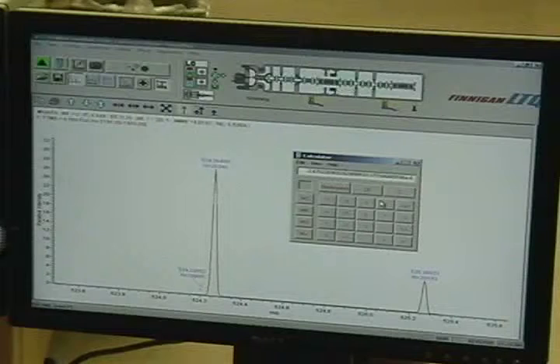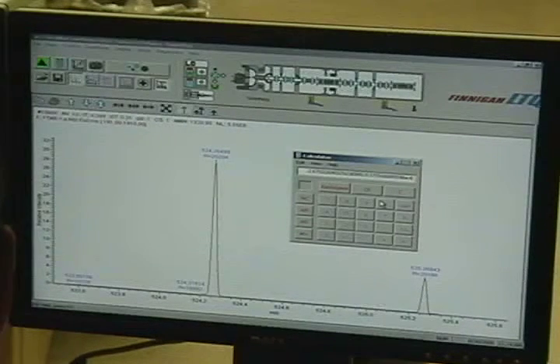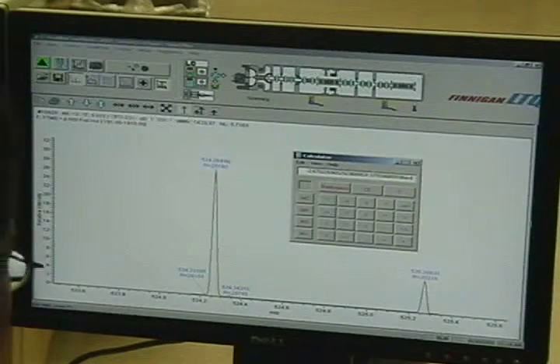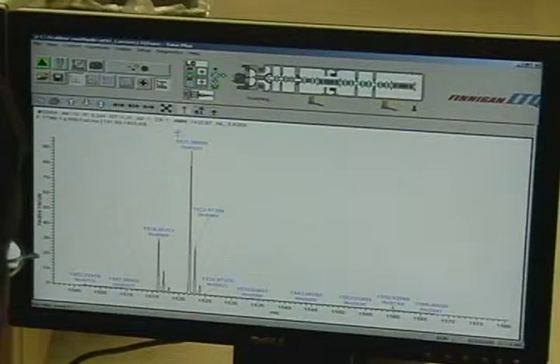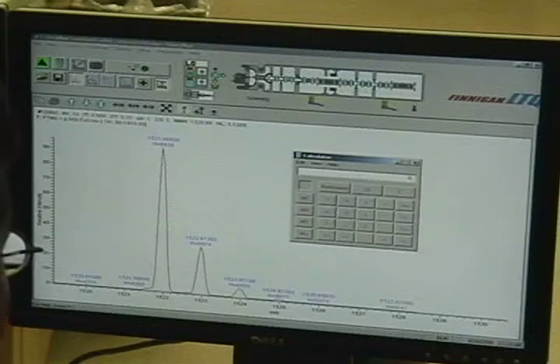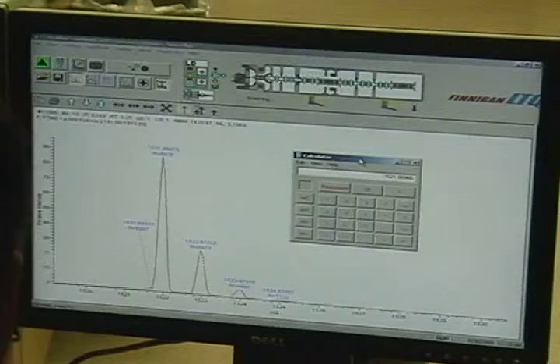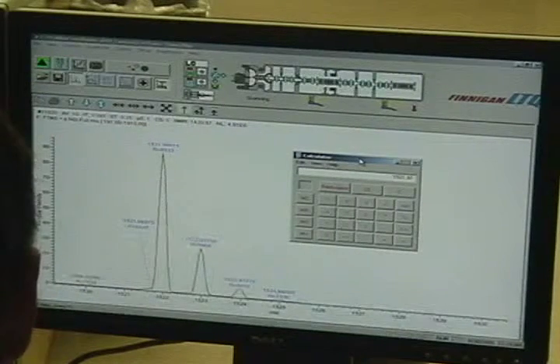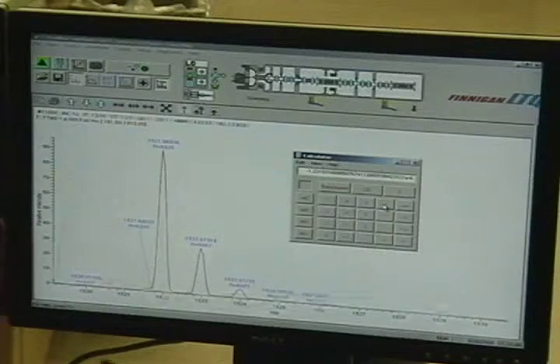Oh yeah! Man, you're dead on in the MRFA. Gotta love 1/100,000th of a mass unit off. Yeah. Now let's check your 1522. 0.2 ppm.